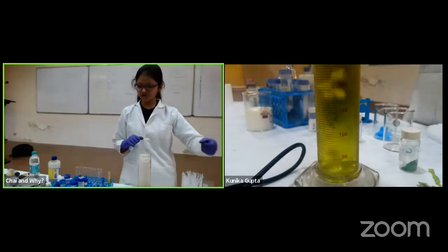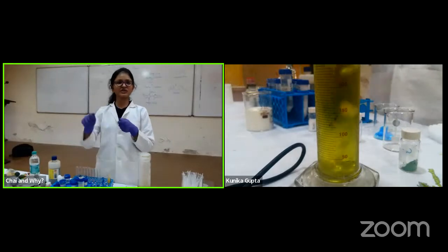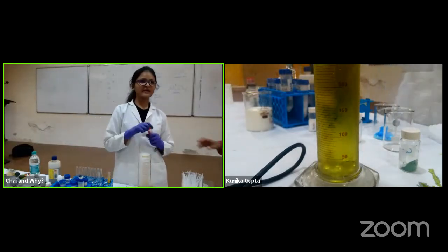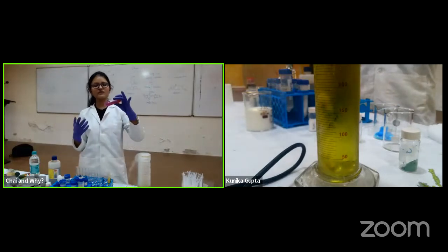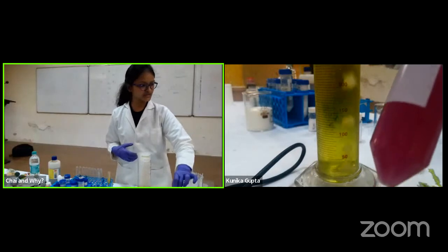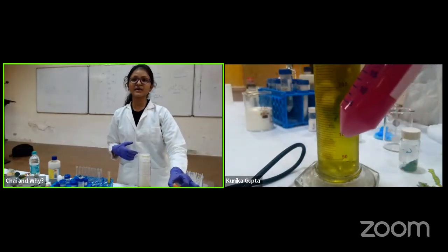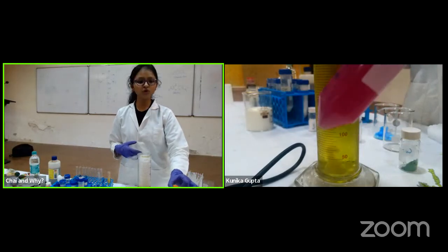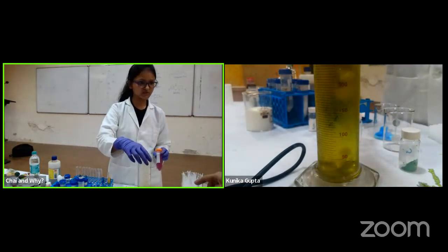So what we have here is cabbage water. Take red cabbage, grind it, dissolve it in water, and boil it, and this is what comes out. It is red in color, as you see here. It acts as a very good pH indicator. You can do this with a China rose, gudhan ka phool, also. We can repeat this one.